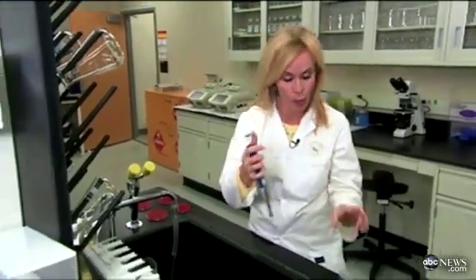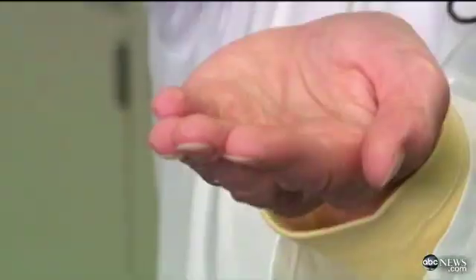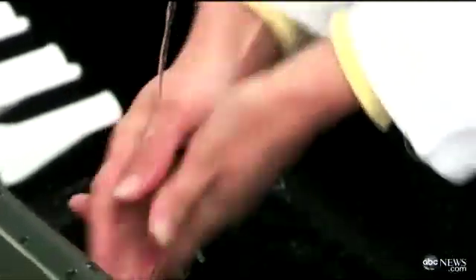The root of the problem is bad handwashing. So I came here to the University of Maryland's Food Safety Laboratory to prove a point. I'm going to put E. coli bacteria all over my own hands, and then wash for just seven seconds with no soap, because studies show that's exactly what most Americans do.